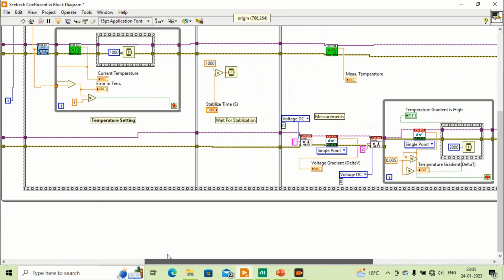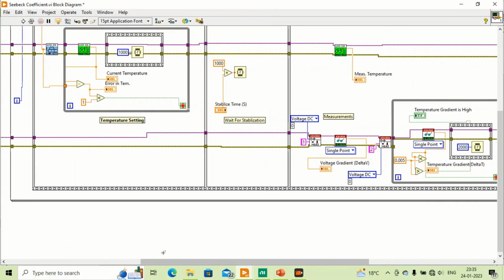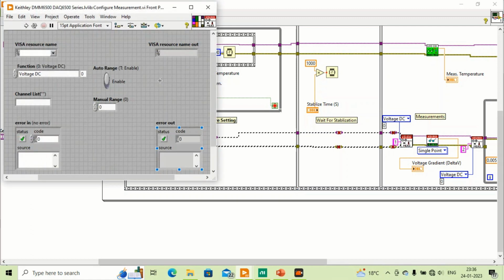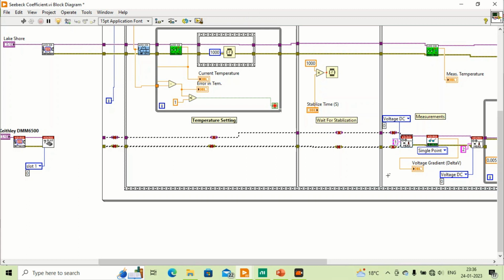Okay, but see, one important thing we have forgotten: whenever you put a probe for voltage measurement across the two ends of the sample, there will always be some voltage that is called offset voltage. So in order to calculate the Seebeck coefficient, we should reduce this offset voltage. So first we will measure the voltage difference across the sample before we start measurement. So we will first put a measurement VI here, and also we will see data, what is the value of the offset voltage.